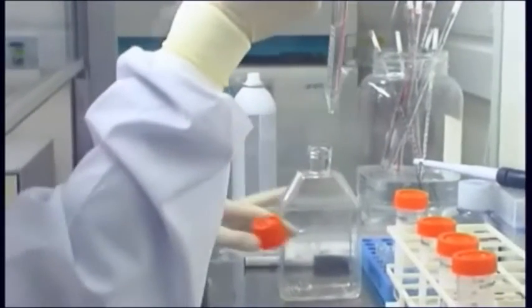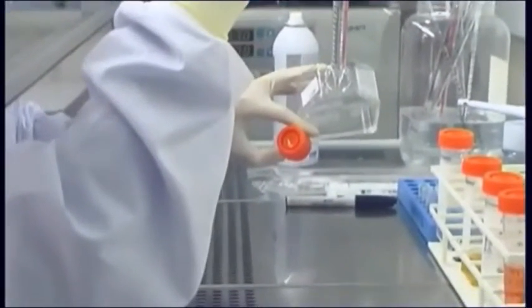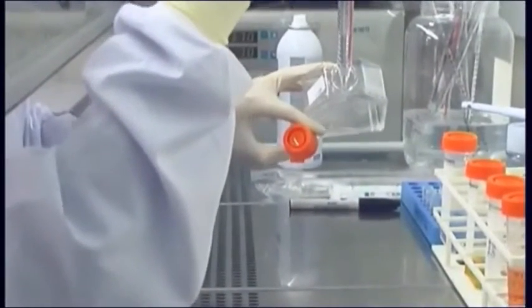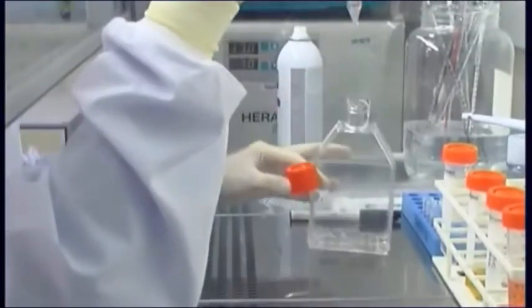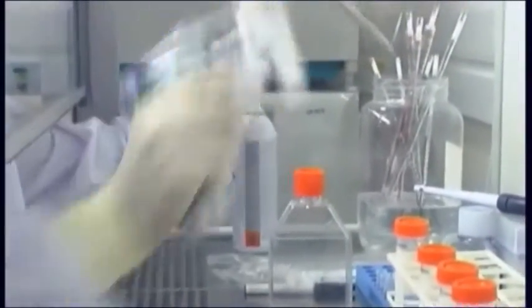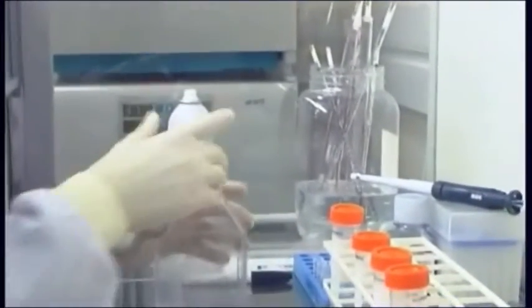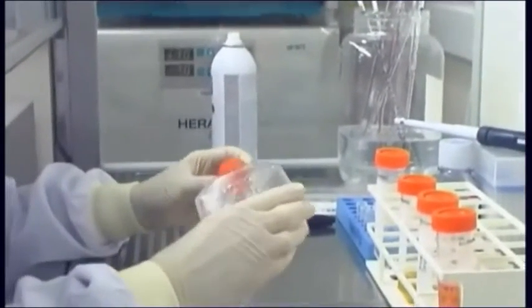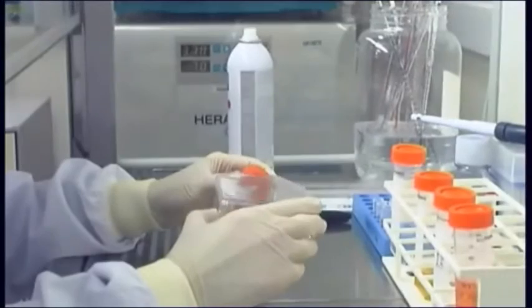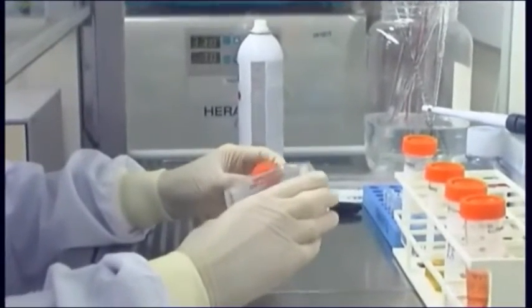Wash the monolayer by addition of calcium and magnesium free physiological buffer. Take care at this point to avoid pipetting buffer directly onto the monolayer, as this can cause significant cell loss. Carefully rock the buffer back and forth to dilute and remove protein.